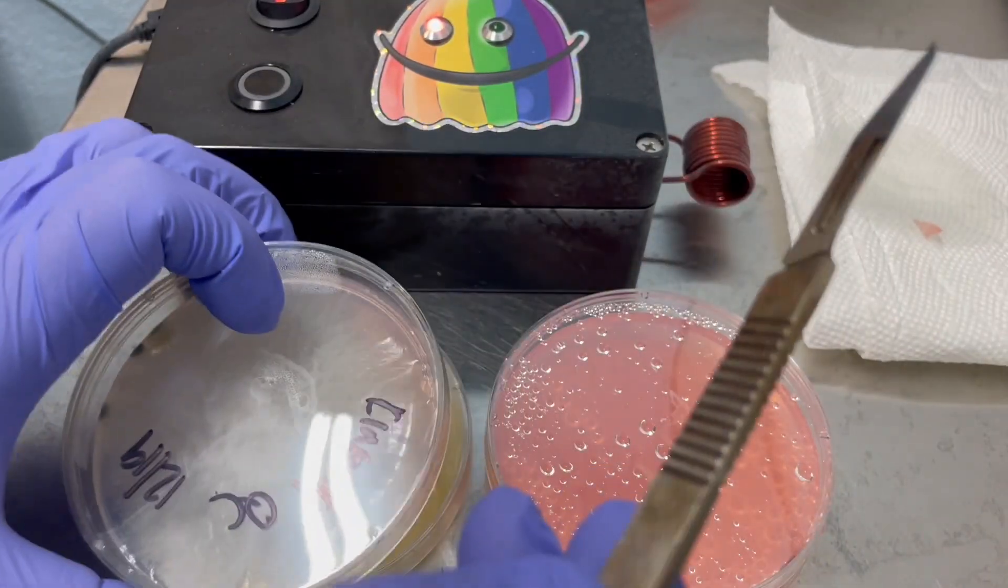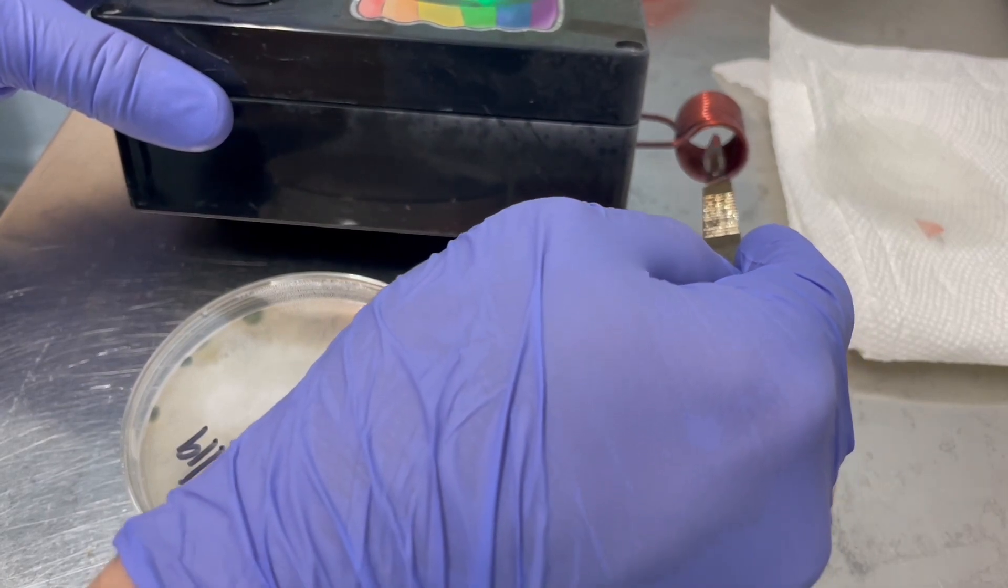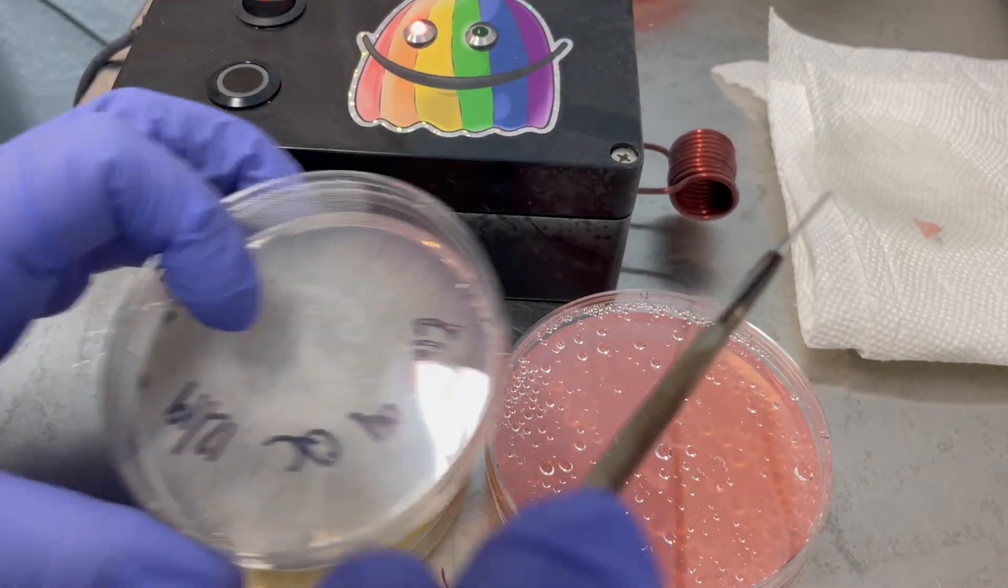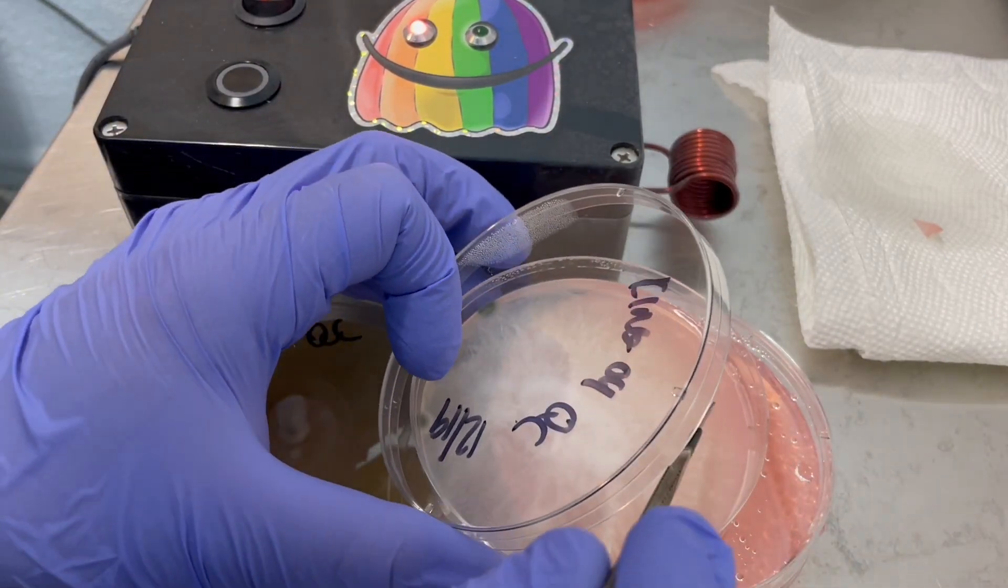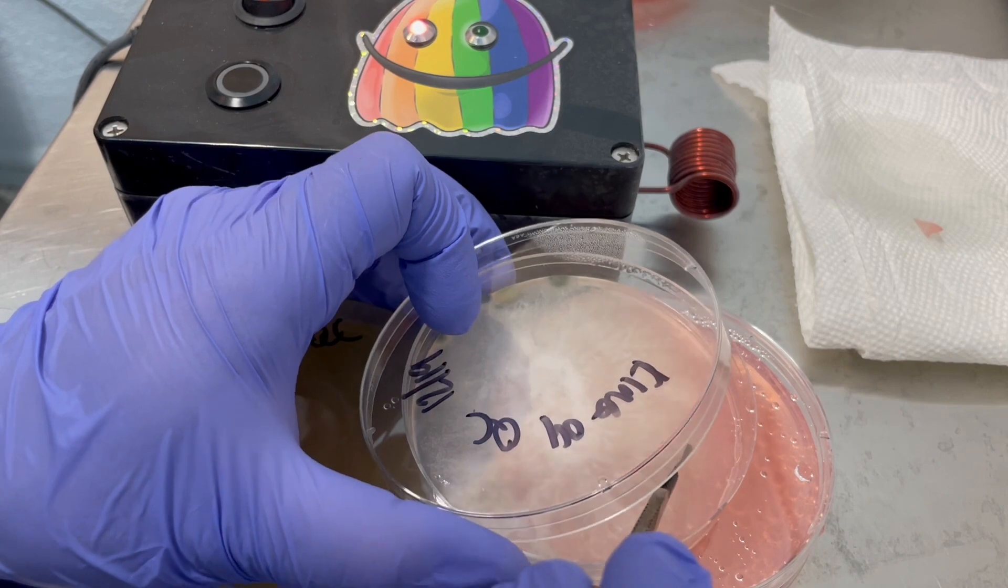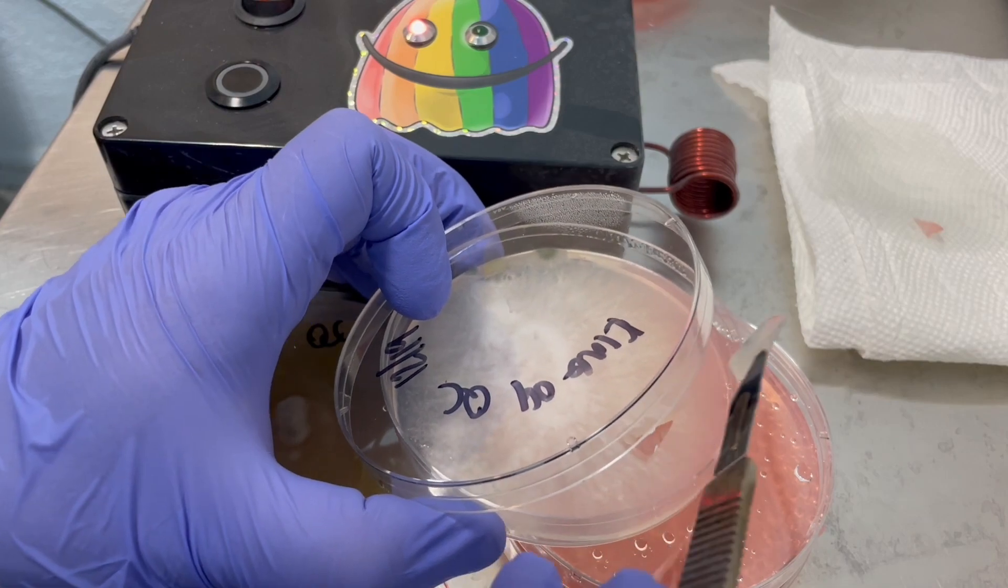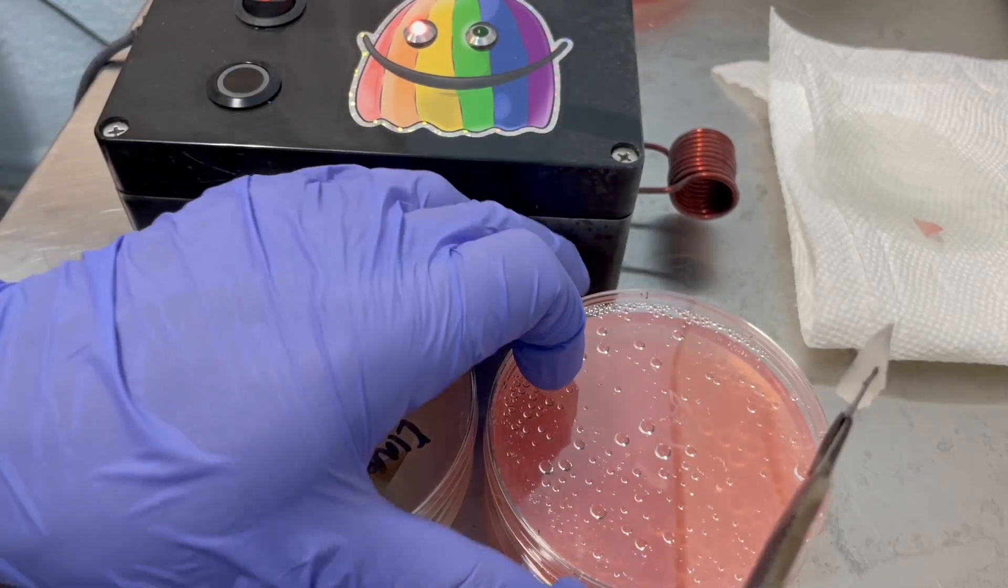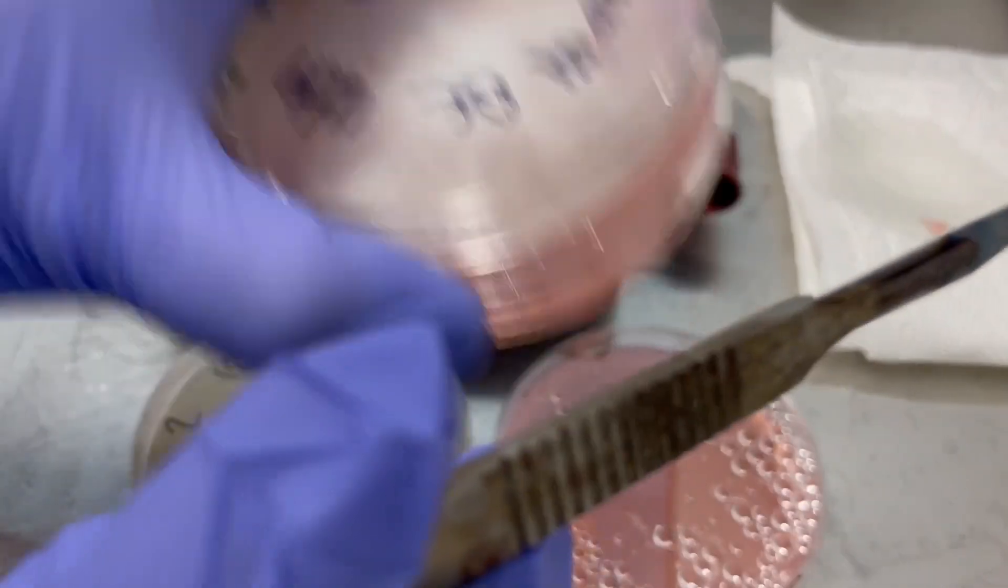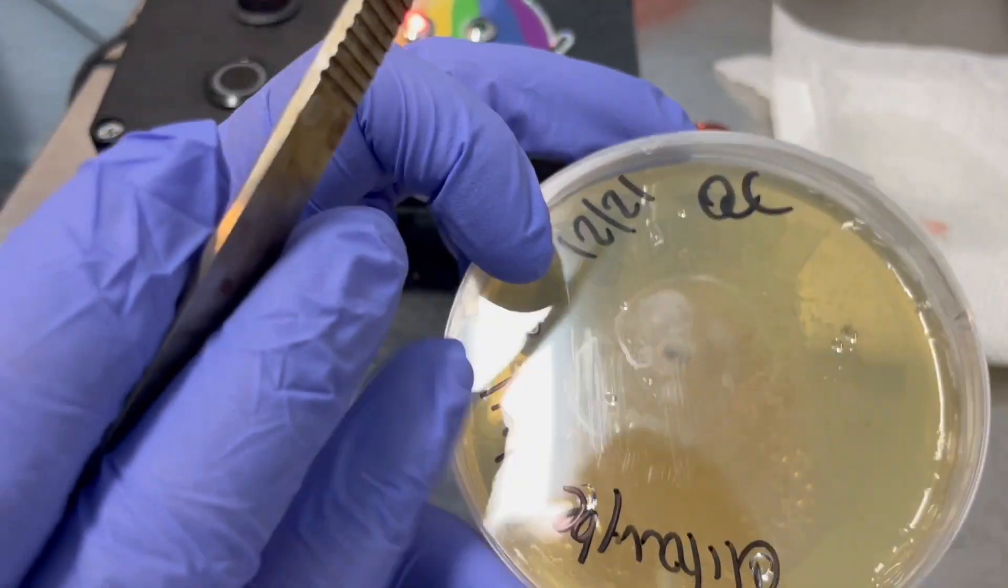And then I just touched the outside of that dish one more time. So you can see I'm a little rusty from taking some weeks off for a new baby. Now some people might be against that cauterization, but king oyster mycelium is very strong. So it should be able to handle a little bit of burning.